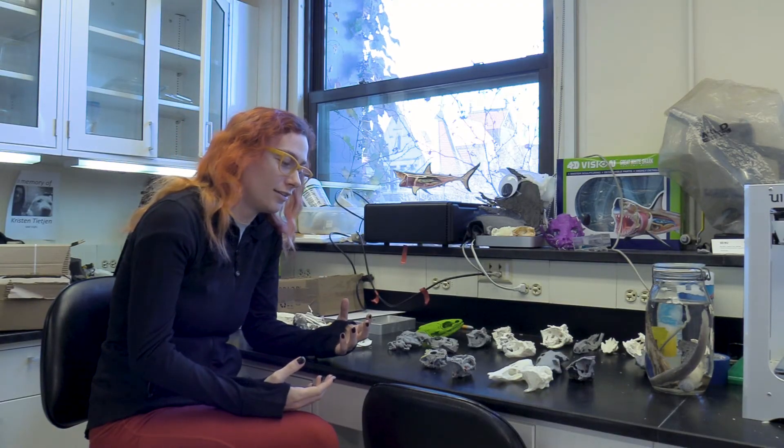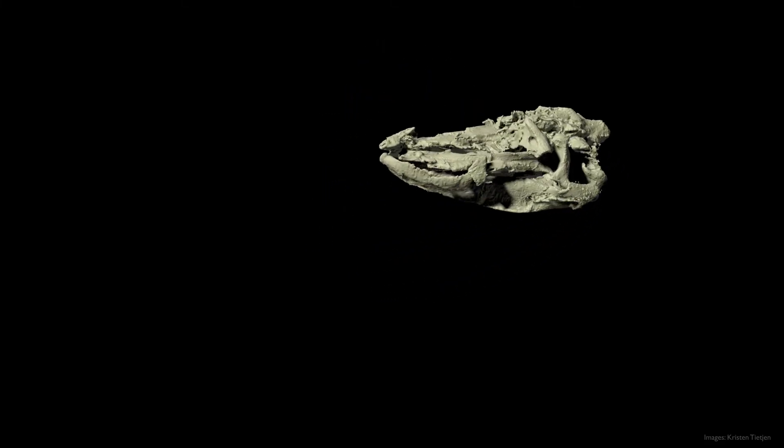You can just put a specimen in a scanner, do a careful scan and careful segmentation — it's time consuming, but there's so much you can get out by understanding all the anatomical details. Not only hard tissue like bones and teeth, but insights about soft tissues as well. We're getting a much better idea about how these fish fit into the tree of life, and that helps answer one of the big questions in this lab: understanding the evolutionary roots of modern vertebrate biodiversity.